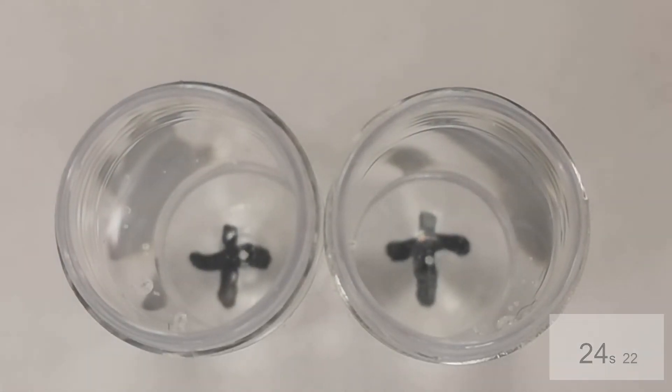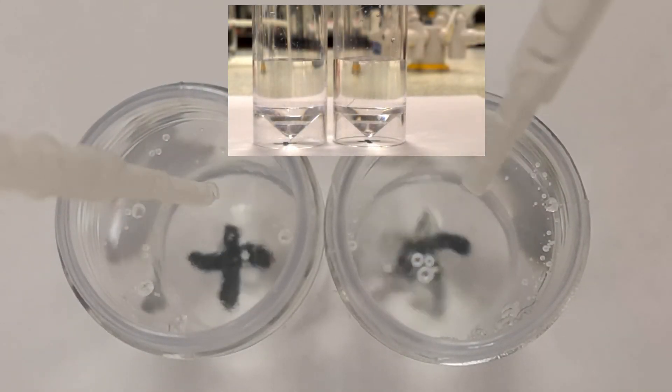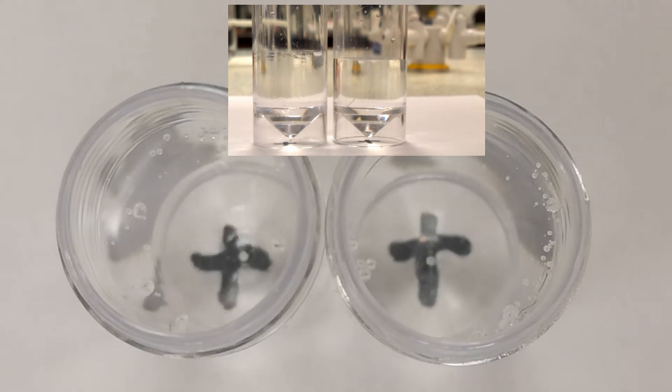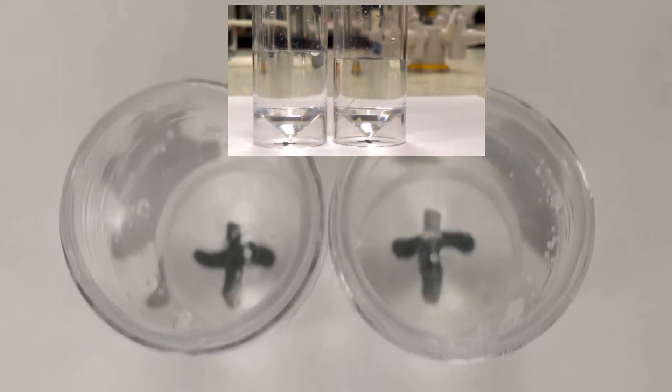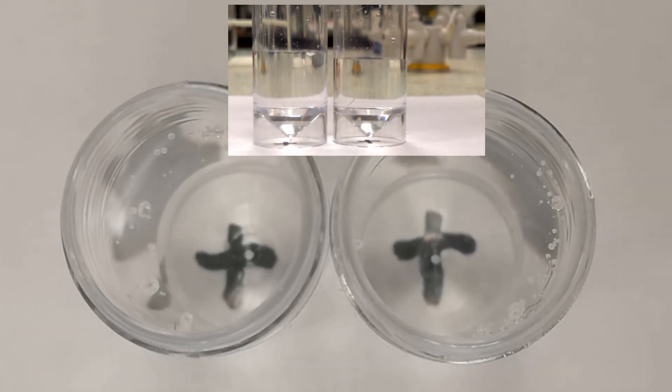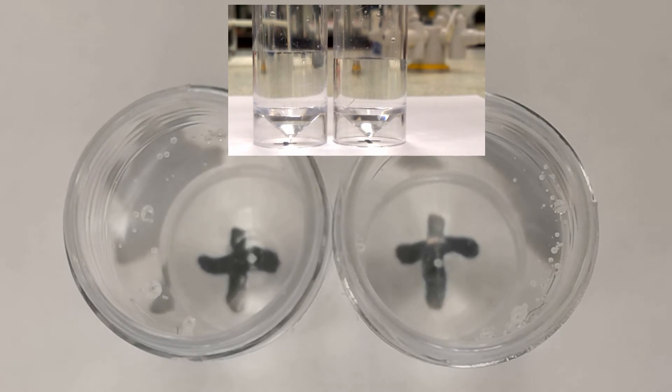The final factor we are looking at is concentration. This reaction is the classic sodium thiosulfate acid reaction. When the two solutions are mixed, the reaction produces colloidal particles of sulphur, which make the mixture go cloudy. You can follow the reaction by seeing how long it takes for a cross drawn underneath the tube to become obscured.